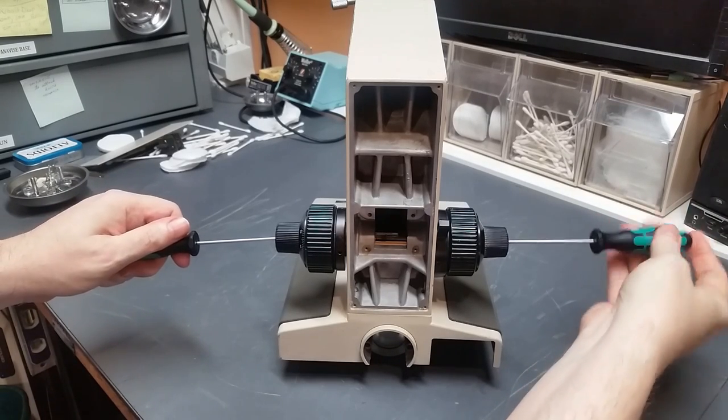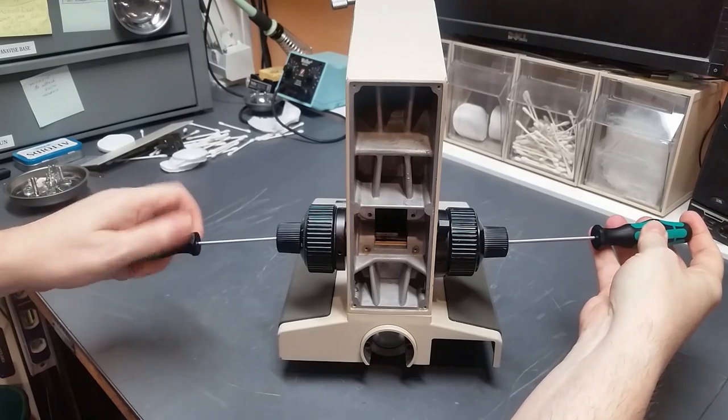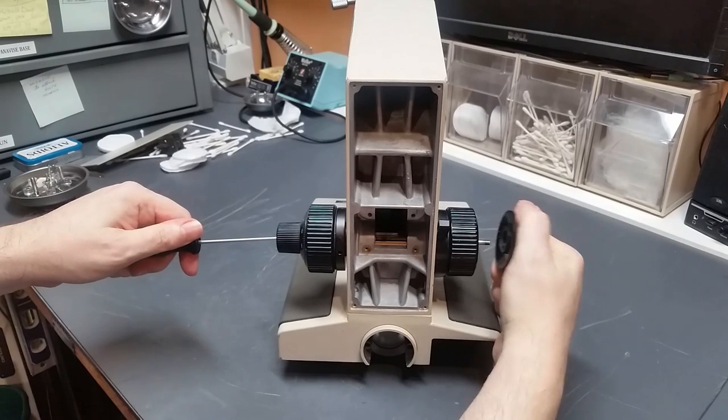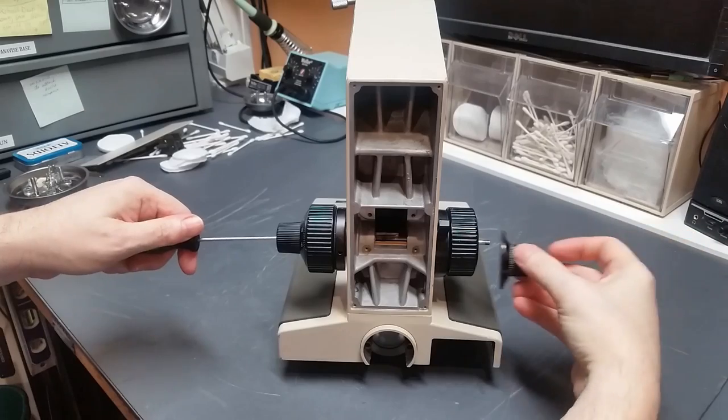And yes, it seems to be this side that's loose. Once we get that done, we just pull this knob off. Since the screw loosened on this side, this is the knob that will come off.